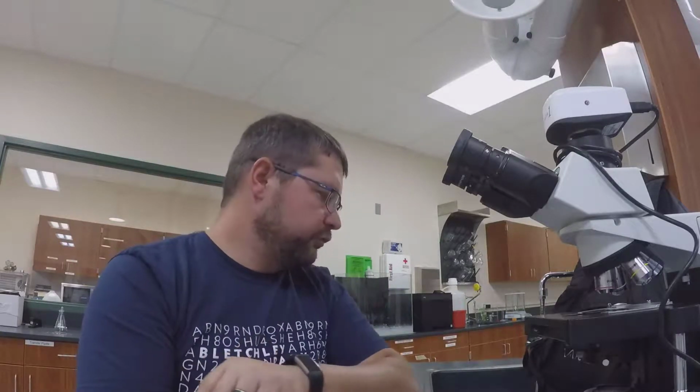And you can see by the diagrams on page 42 in your lab manual the pieces of the microscope. The microscopes that we use are sketched there with the pieces labeled on the next page. Just be familiar with those pieces.